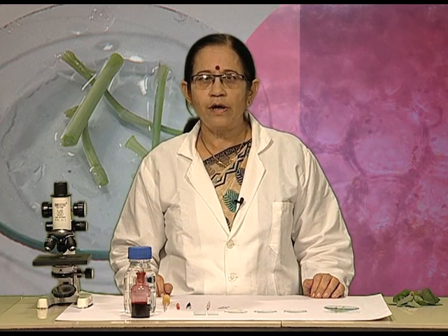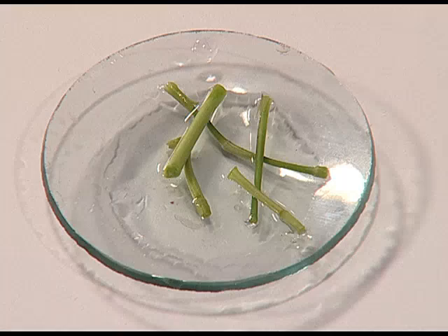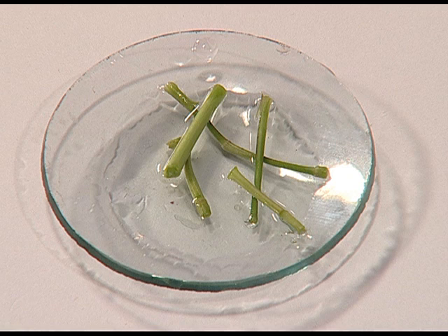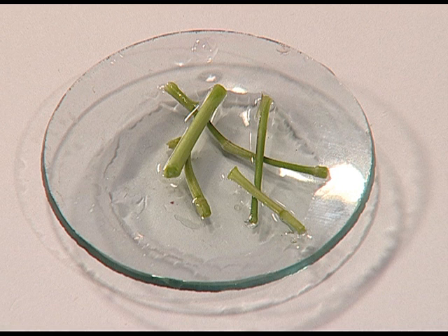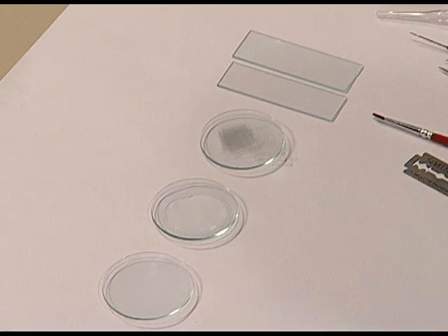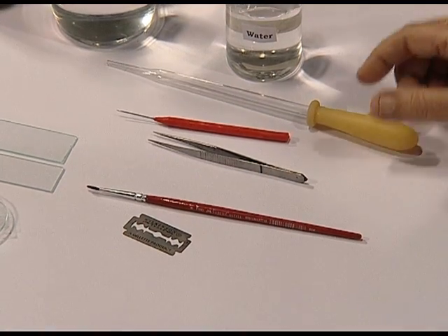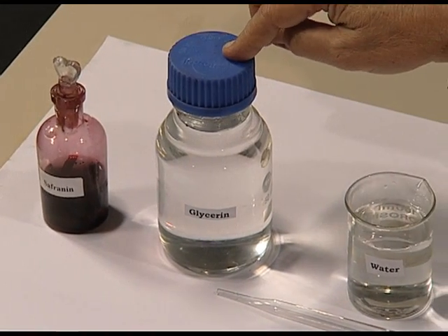Today, students, we will be studying about parenchyma and sclerenchyma in a temporary stained slide. For this, what do we require? We require the plant stem of a herbaceous plant — this stem should be soft and should be cut into about 3 centimeter pieces and put in water. We require some watch glasses, slides, cover slips, needle, forceps, brush, blade, dropper, stain such as safranine, and for mounting we require glycerine.